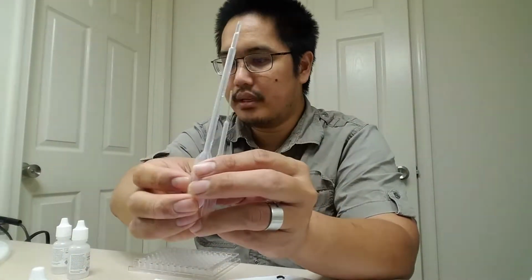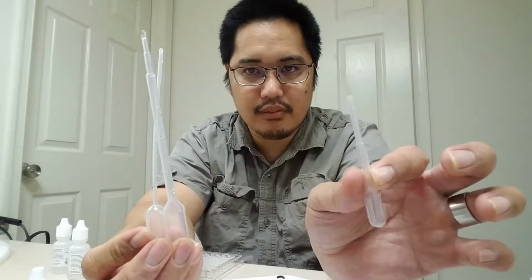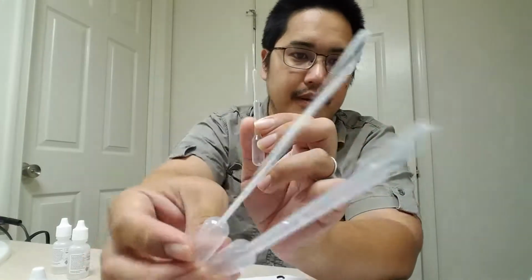All right, first thing, you're going to need some calcium nitrate. Okay, wait, that's copper nitrate. Here's calcium nitrate. And some sodium oxalate. That would be this guy right here. You're going to need a 96 well reaction plate, a mini pipette. Here's my regular, or graduated, pipette. This one right here with a really thin end, that's a mini pipette.